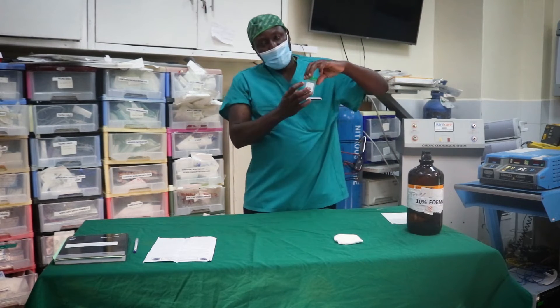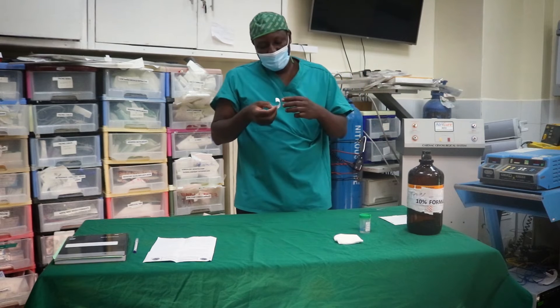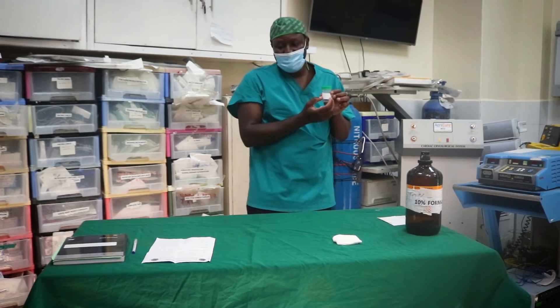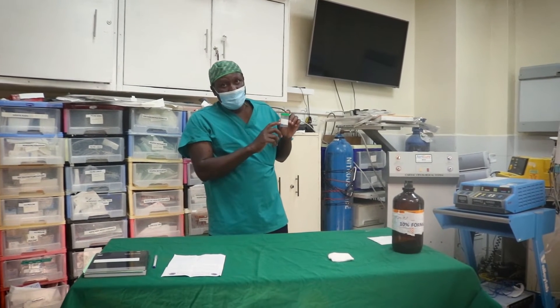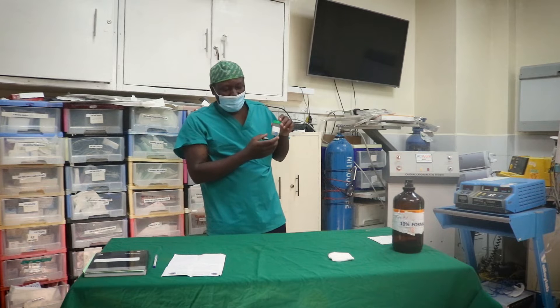Pour just enough formalin so that the tissue can be fully immersed, then close the container. That is the first step. If your container is not labeled, we have pre-made stickers that we write and label on the container. The sticker should have at least seven things: the patient's name, gender, age, hospital number, the surgeon who performed the procedure, the date the procedure was done, the specimen, and the facility where the specimen was taken.